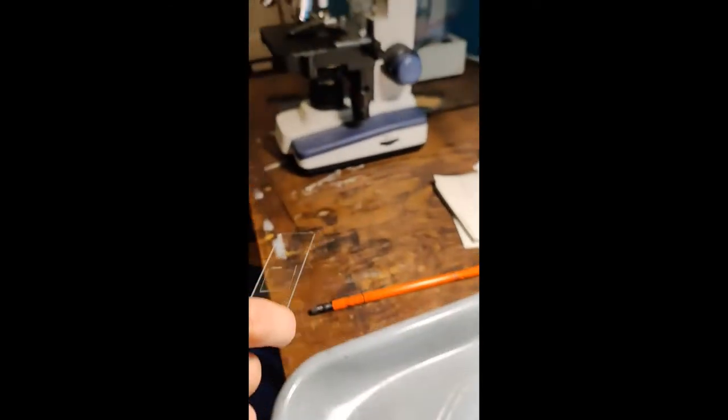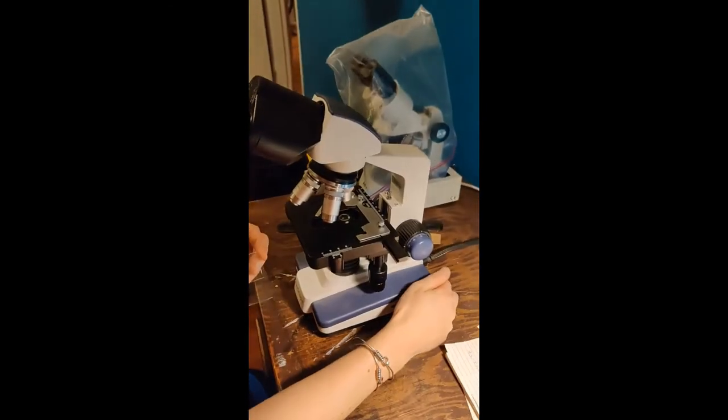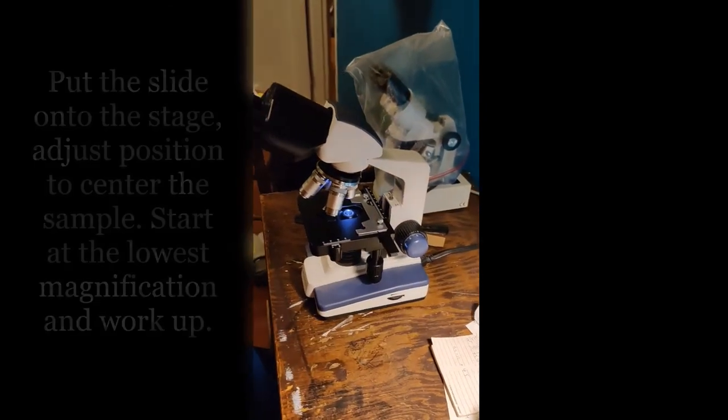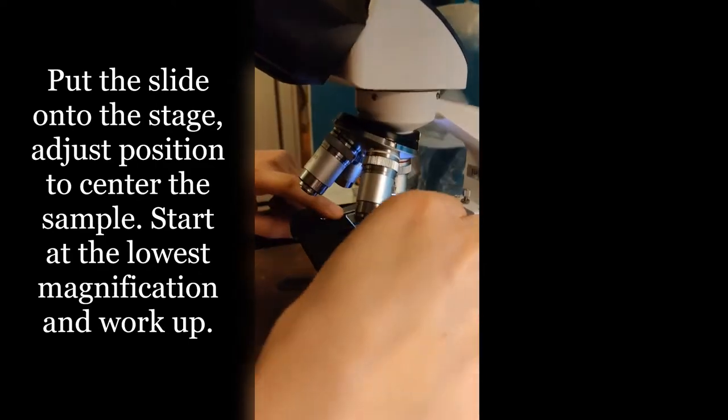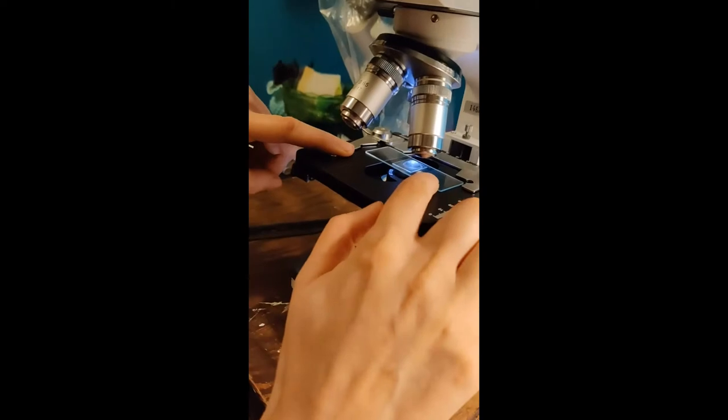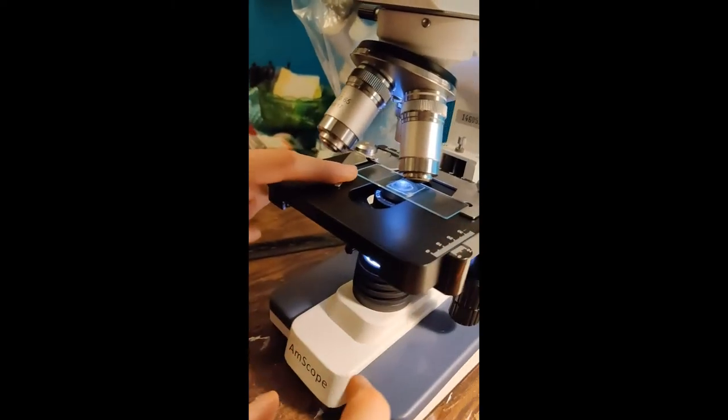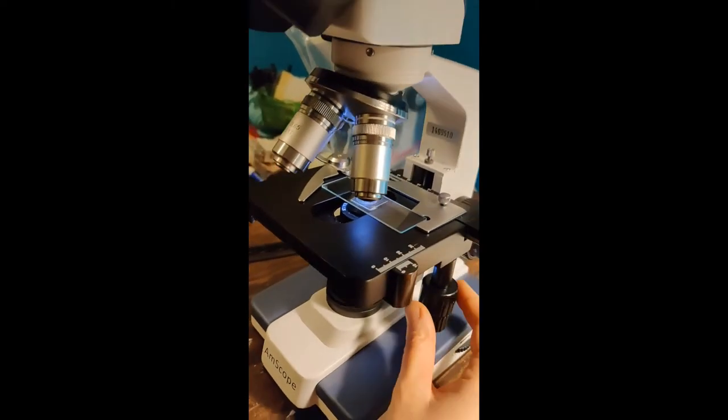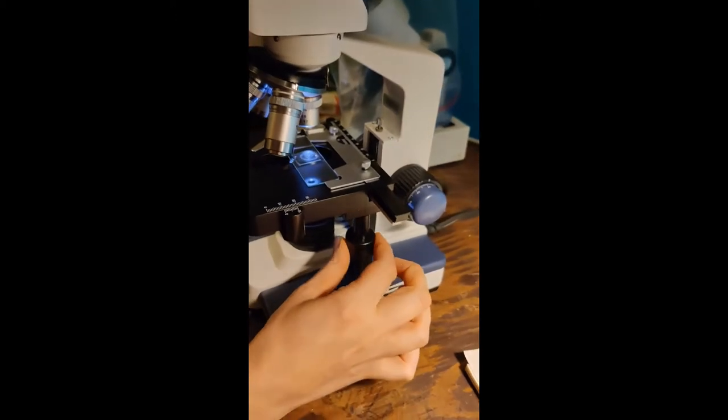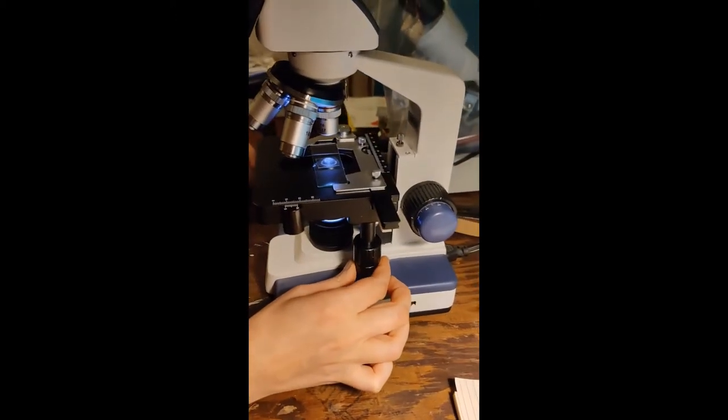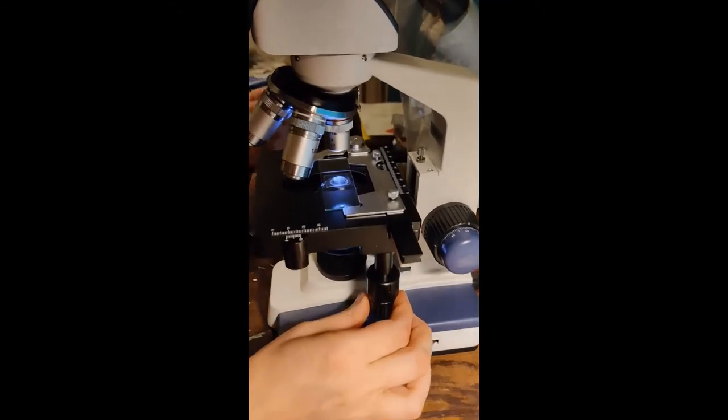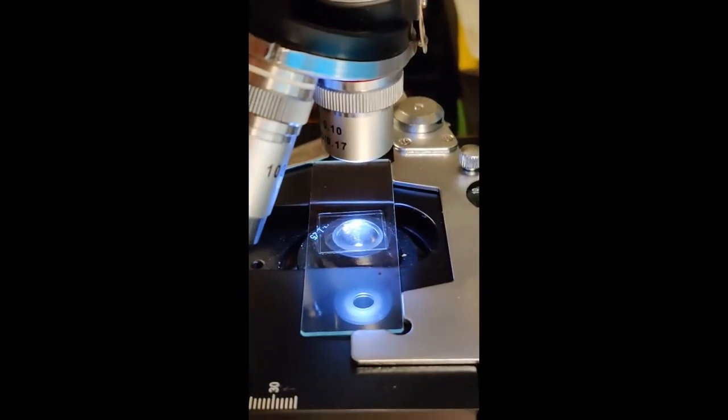And then I'm going to turn on my microscope. And there's this little arm here. I'm going to put it inside here, it gets held with the edge and the arm goes into place. And then I use this thingy right here to adjust where the slide is, and I make sure that it goes so that it's lined up with the objective here.